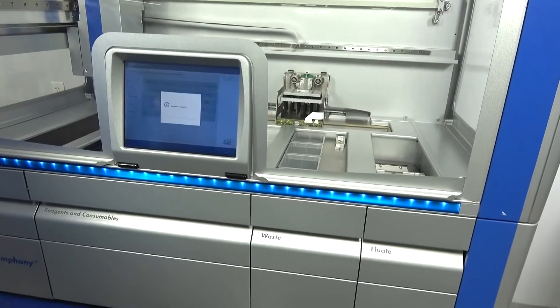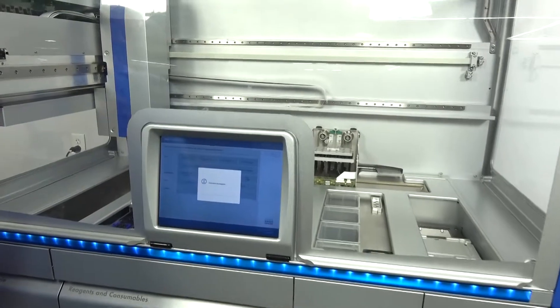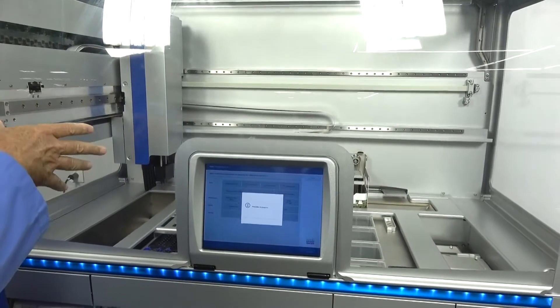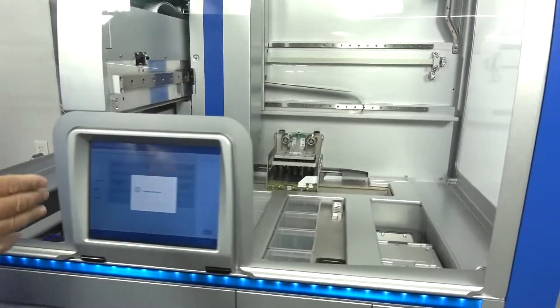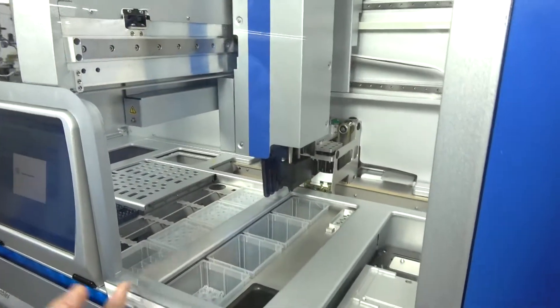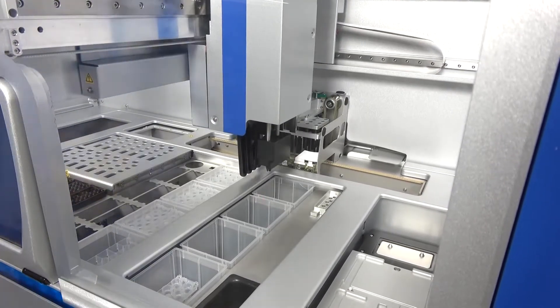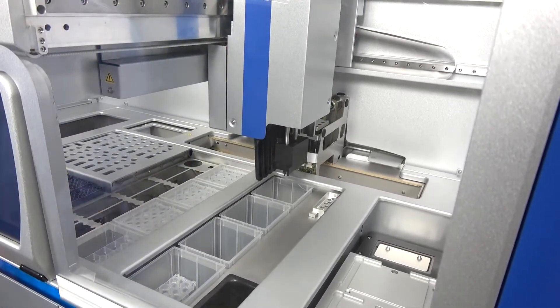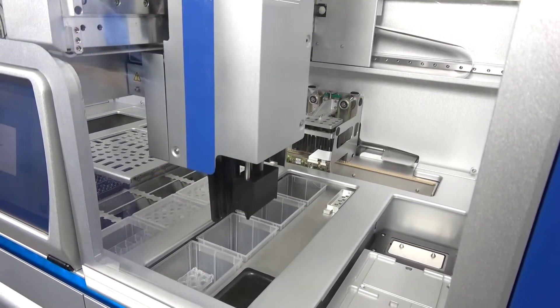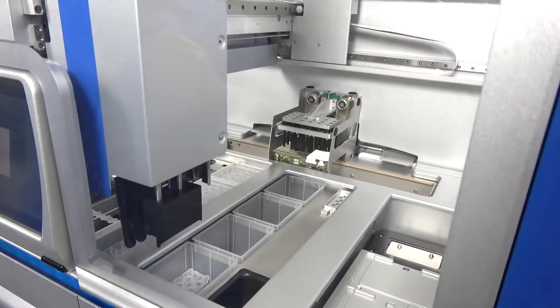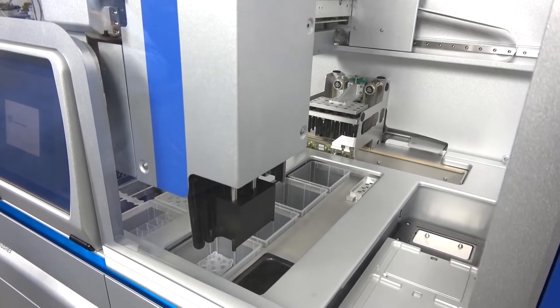We want to check all the racks are out. If this was the cold section there. Now it's going to, here in a second, pick up several pieces of plastic, put them on a rack in the back, on the conveyor belt in the back there. So right now it's getting into position. It's doing an inventory of the plasticware, which it does if you open up the unit in either the drawer or the lid. It's going to ask, has anything changed? It needs to know what's there and it will produce its own inventory scan, which is also part of our testing procedure to make sure that it has the ability to find what's there.